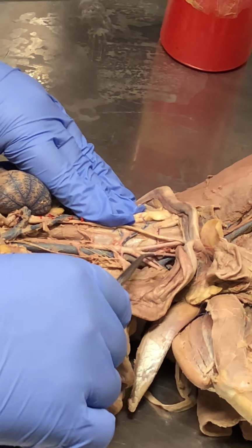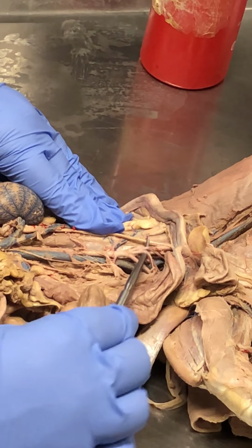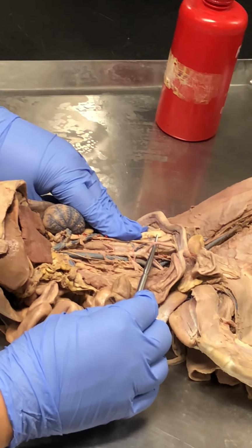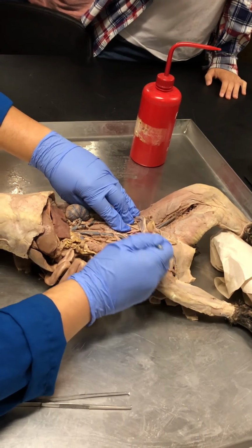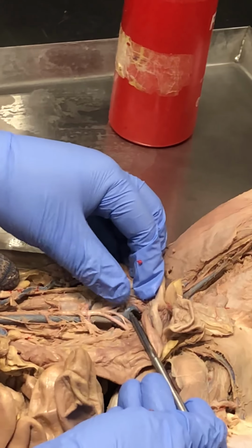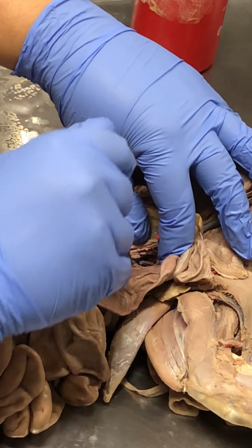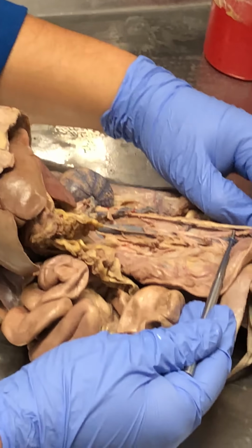Which means that the significantly smaller vessels here, like this one, this is the left internal iliac artery. And here's the right internal iliac artery. So these two iliacs are much smaller than their external counterparts. Okay? There is no common. What about the veins? Same thing. They have the same type of arrangement. Here is the left external iliac vein. The internal iliac, well, here's a right internal iliac vein right there.